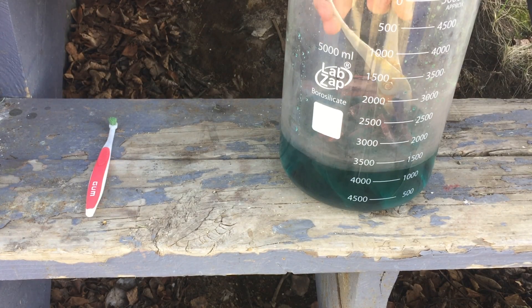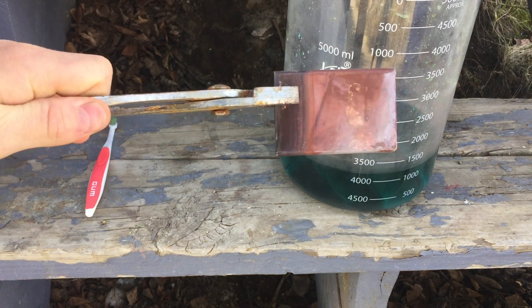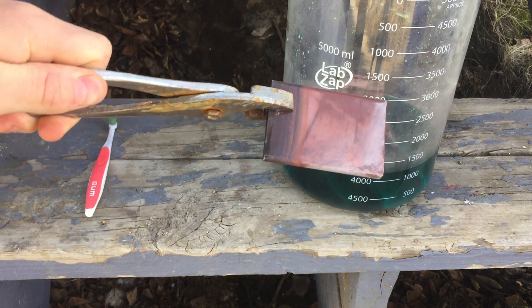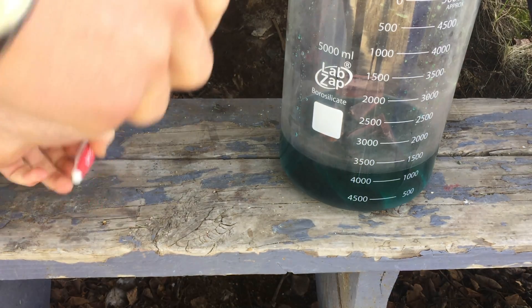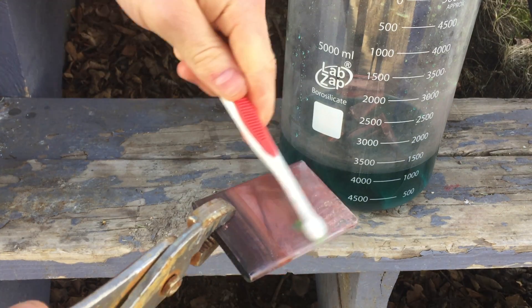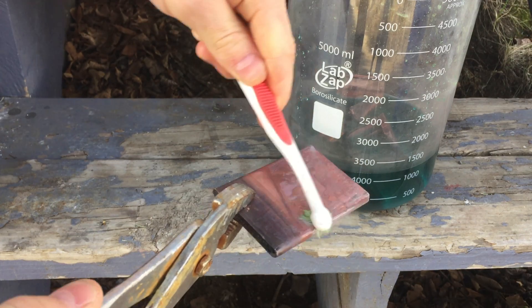After the bus bars had remained in the solution for about a week, you can see that the grand majority of the silver has been removed and the solution is a nice blue color. The blue coloring is due to the presence of copper ions that are dissolved in the acid. You may also notice that the bars are coated in a thin white precipitate. This is due to the presence of silver chloride. It must be scraped off and washed away into the solution so that it can be collected later with the rest of the silver.